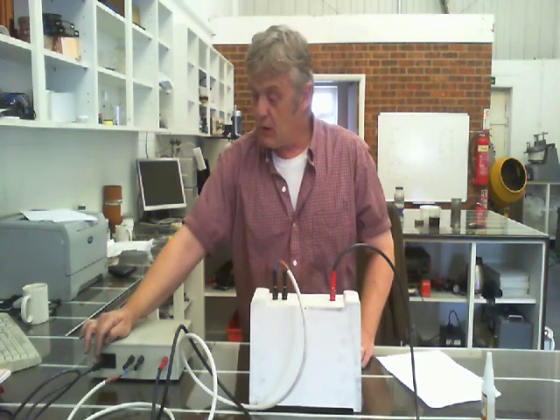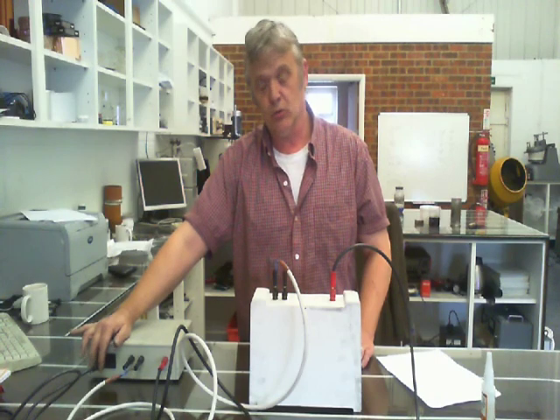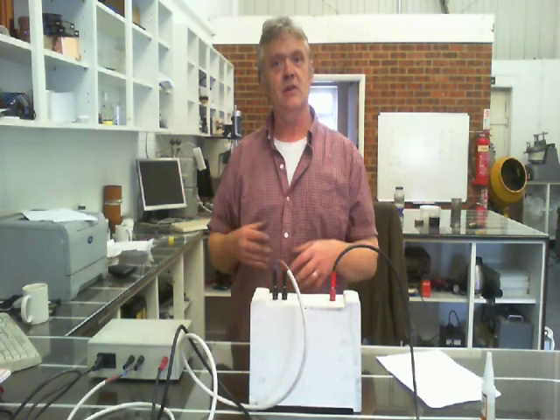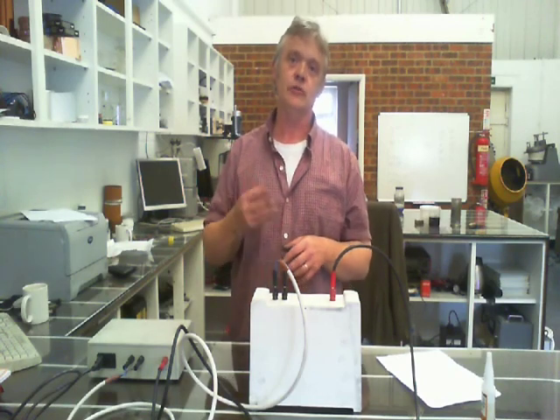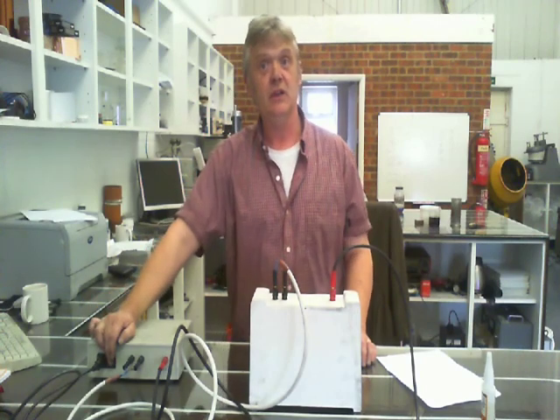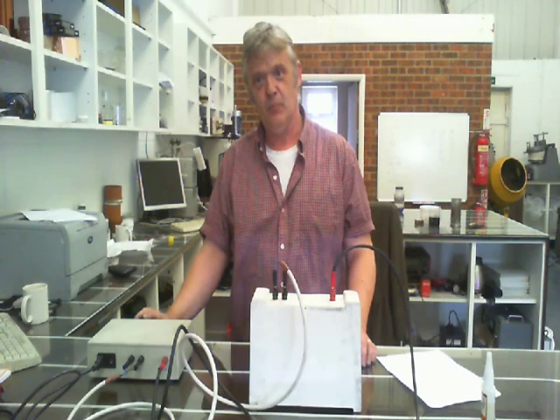The lead I actually just scavenged. So this is just a scavenged lead that I got from an old computer, and it's turned off at the moment. Now when I turn it on, it'll begin to flash. It flashes quicker than you'll see it flashing because the camera has a little bit of trouble picking it up. There you go.